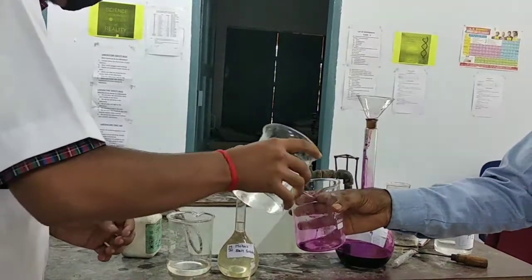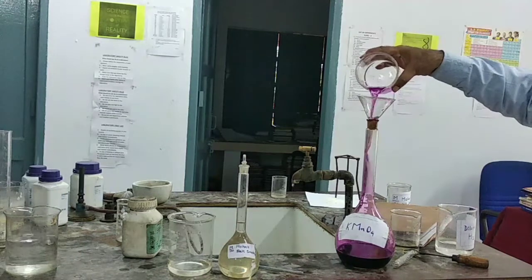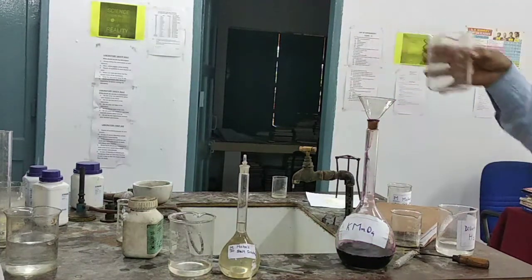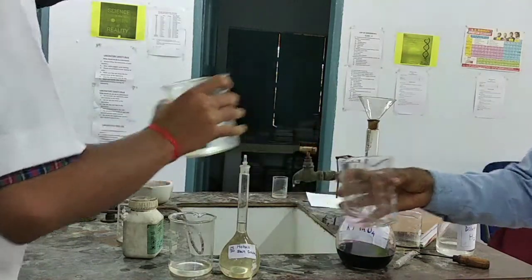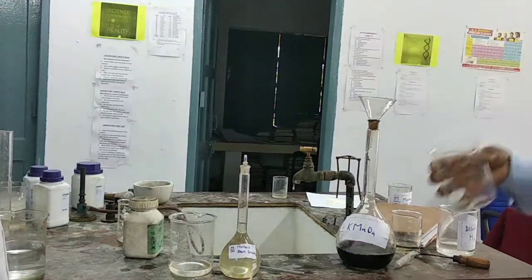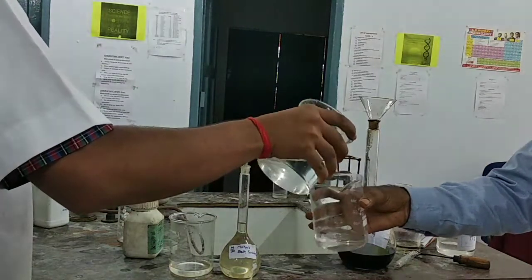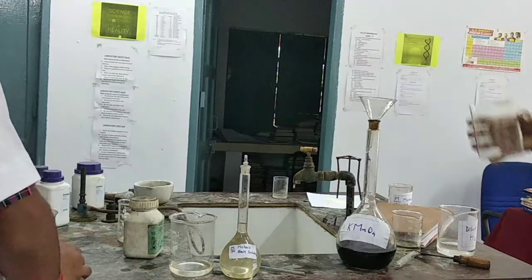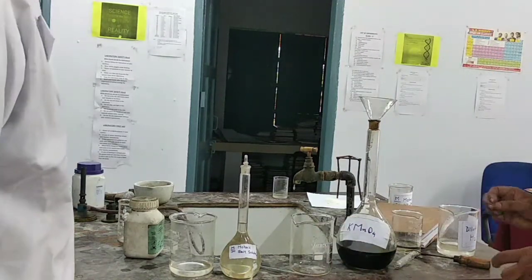Some more water is required. Okay, wait. Some more water. I have prepared two solutions.